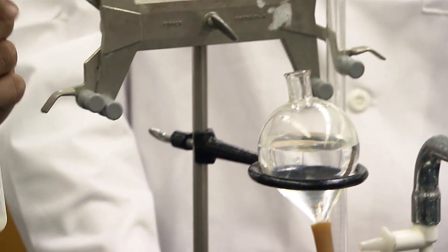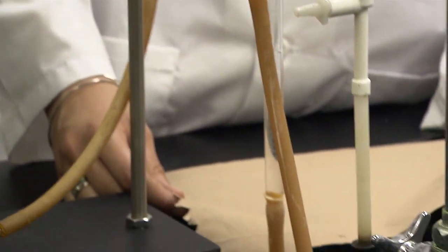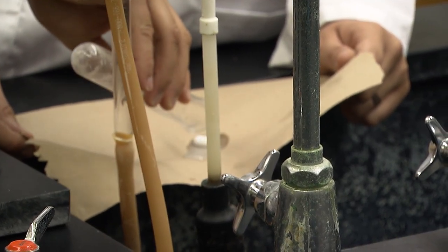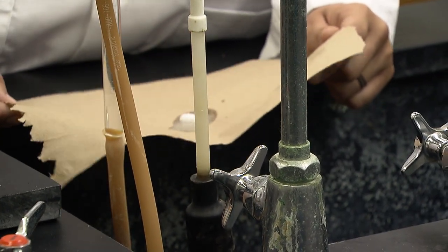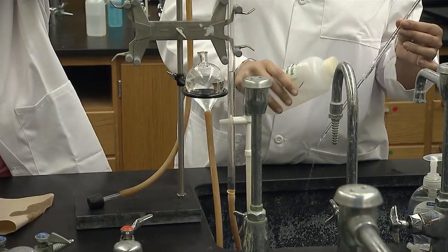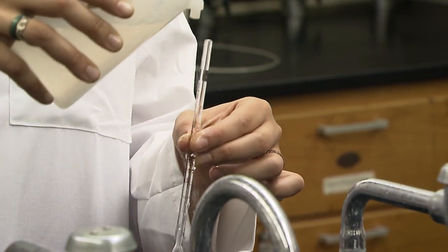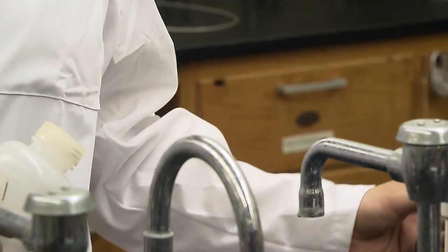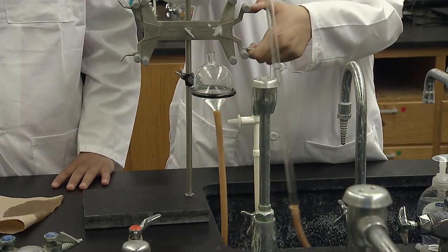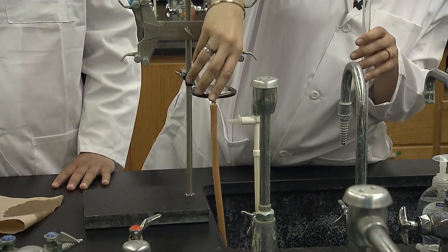Empty the test tube into the sink, but pour through a paper towel so you keep the small magnet. Wash and dry the test tube and small magnet between each trial. After all 3 trials, you can rinse the pipette and return to cart. Lift the bulb and burette to pour out water into the sink. Return to the cart as well.